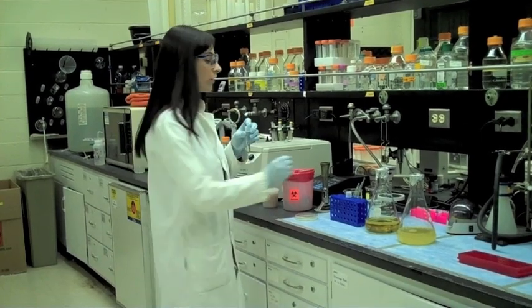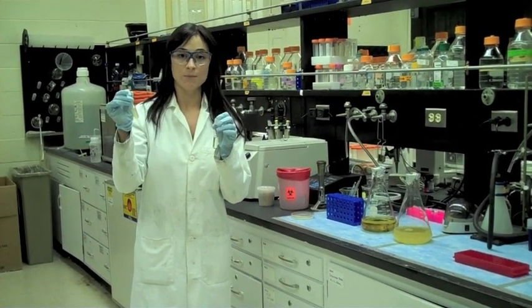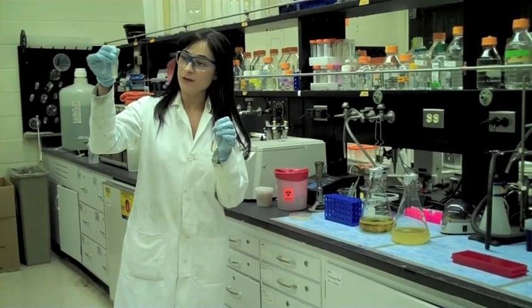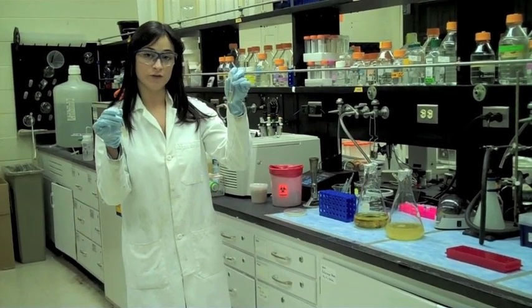In order to determine if the cells are growing, we can tell because the solution will become more cloudy. You can physically see the bacteria swirling around in solution compared to the point at which we first inoculated.